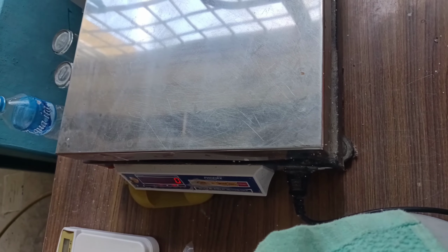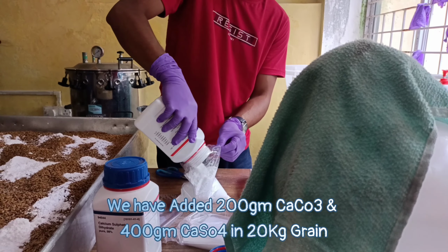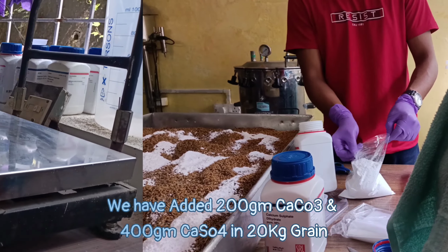Now we are taking 200 gram of calcium carbonate. We have already added 400 gram of calcium sulfate.